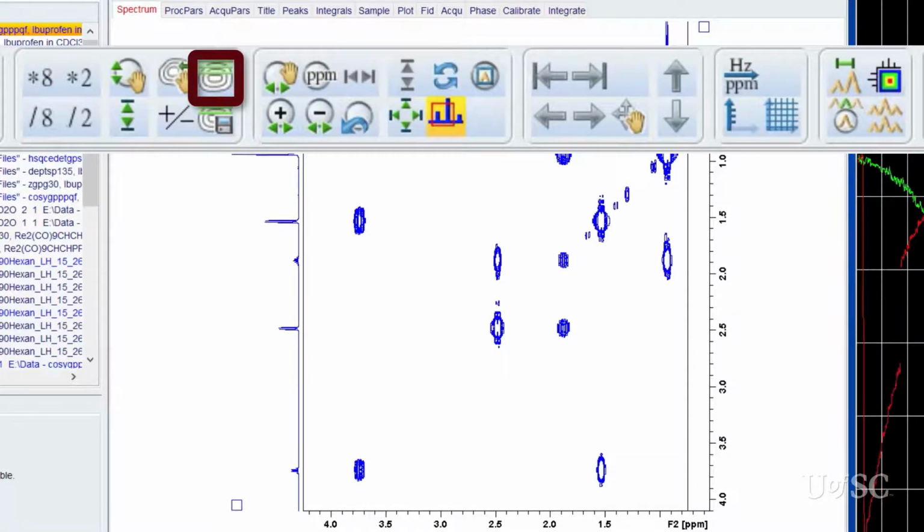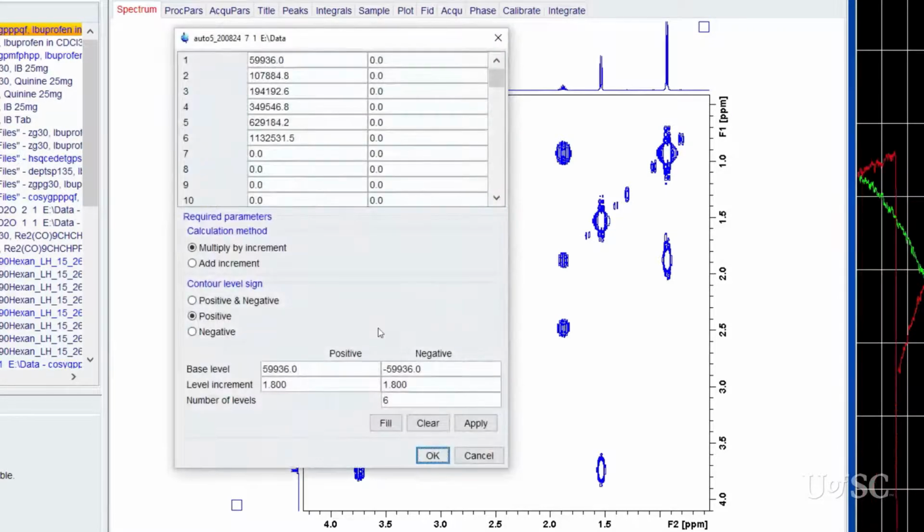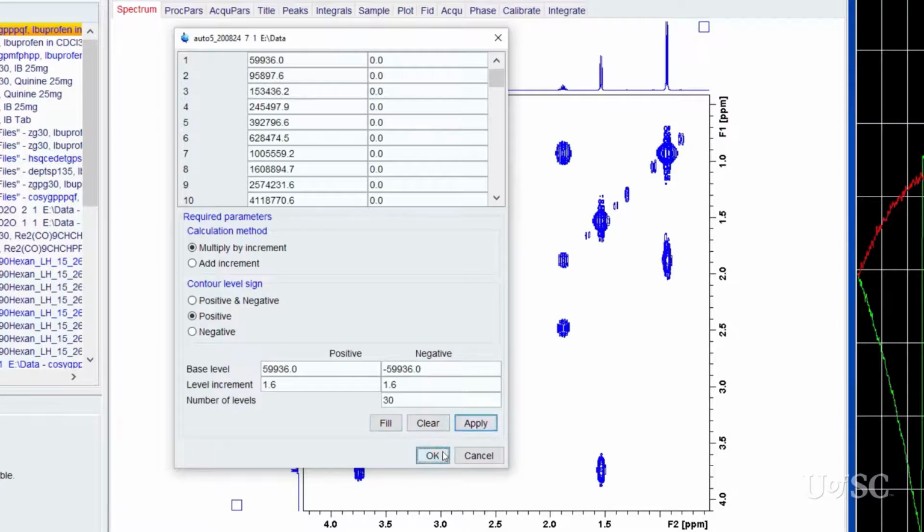In the dialog box, we are decreasing the contour spacing by slightly lowering the level increment and increasing the number of levels to 30. After clicking Fill and Apply, we can exit the panel by clicking the OK button. Notice how the peaks are better drawn.